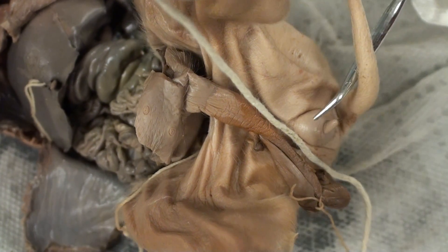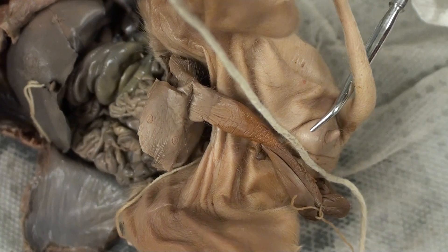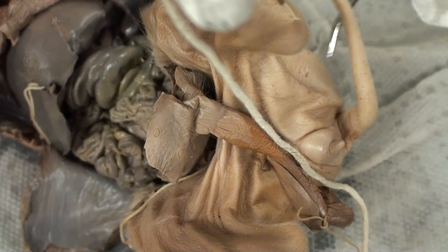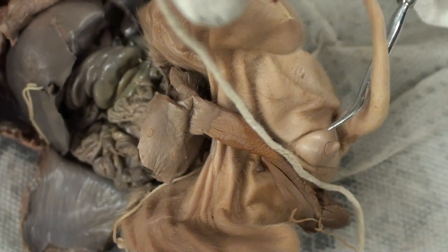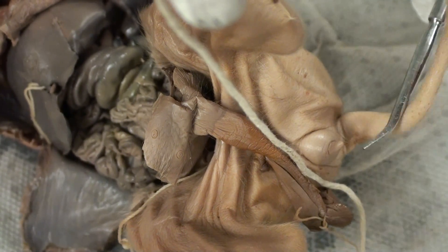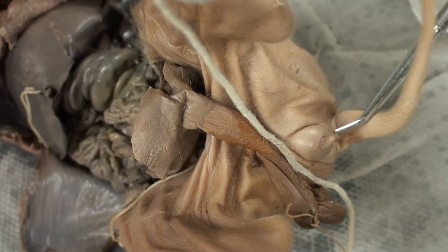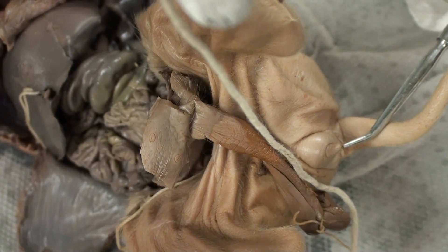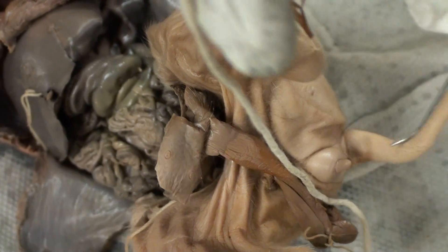Located over here is the horn-like structure found only on female pigs — the urogenital papilla. Located beneath the urogenital papilla is the urogenital opening.